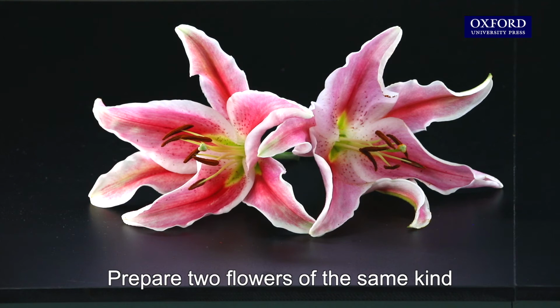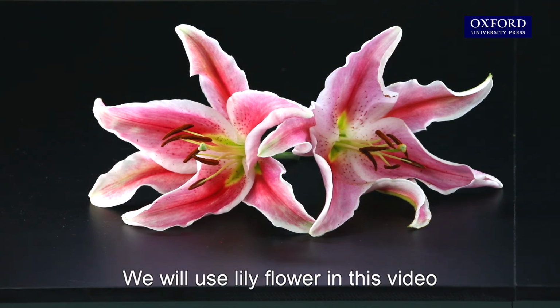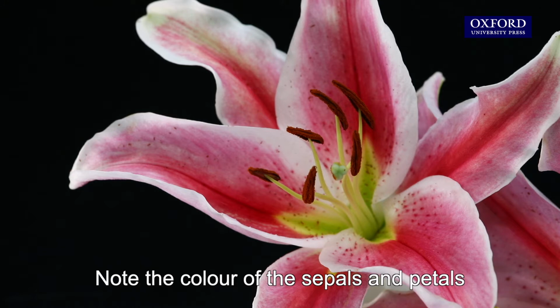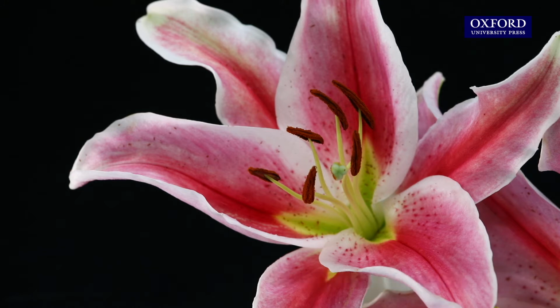Prepare 2 flowers of the same kind. We will use lily flower in this video. Examine the external features of the flowers. Note the color of the sepals and petals.